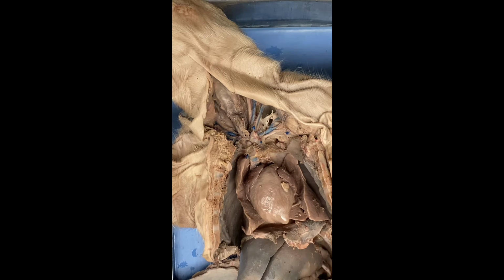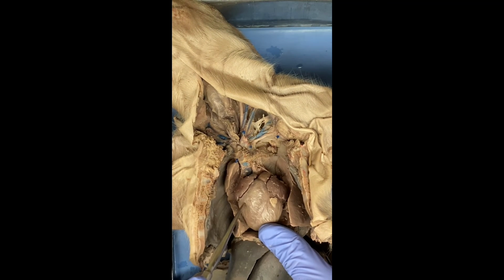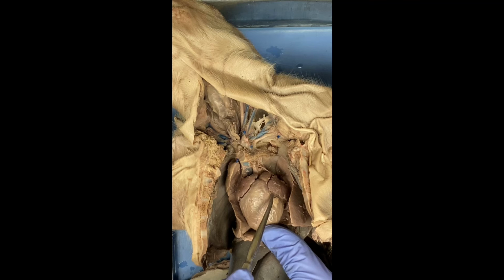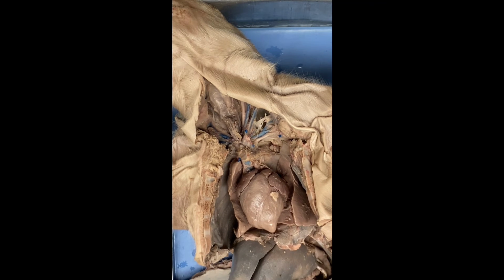So then we have the septum, which is actually inside the heart, but what I can show is this is the right ventricle and the left ventricle, and this dividing line right here is where the septum would be, because these animals have a 4-chambered heart. So the right and lefts are completely separate, and that separation is the septum.